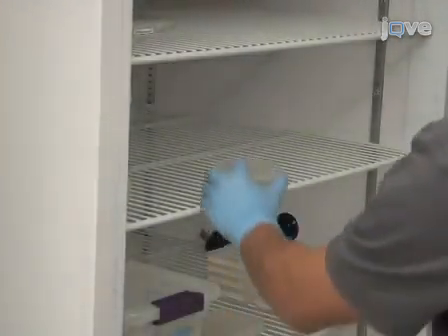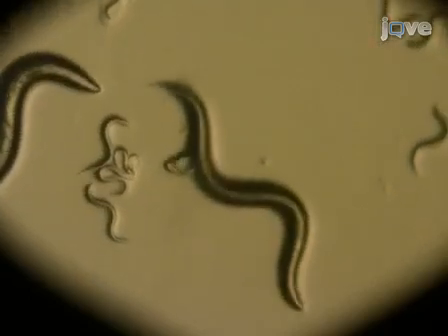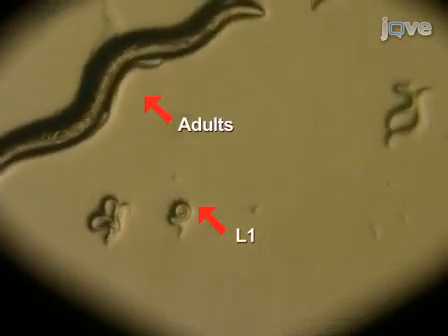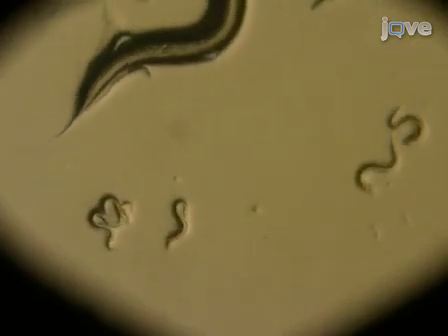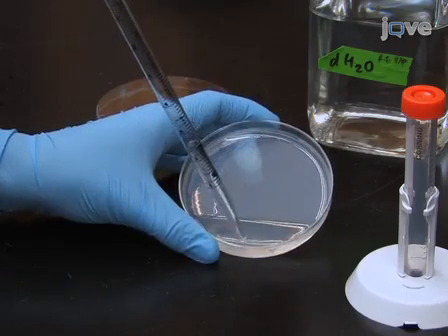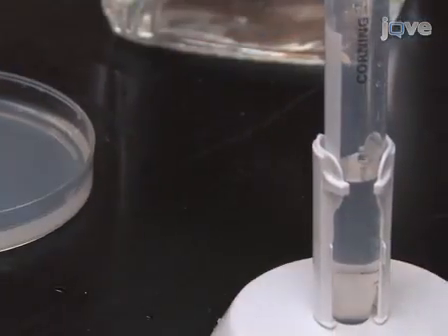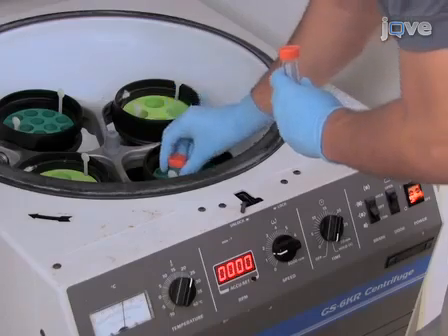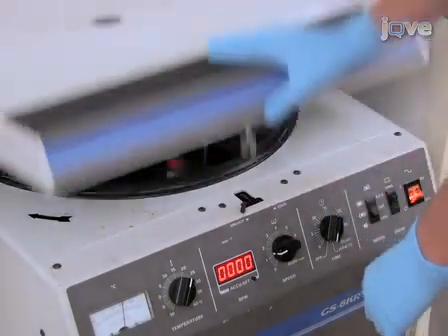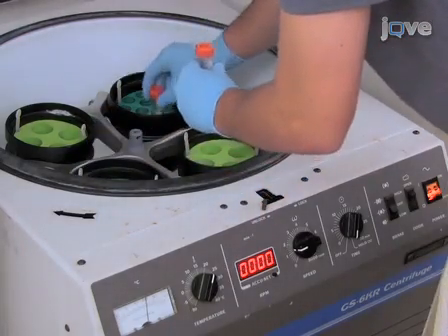Incubate the worms for approximately 65 hours at 20 degrees Celsius until the majority of the worm population consists of gravid adults. The time it takes for the starved L1 animals to grow into gravid adults may vary from strain to strain. After the incubation, collect worms from the 10 cm plate by washing them off the plate with 5 to 10 ml of sterile water. Transfer the worm water solution into a 15 ml conical tube. Wash the worms by centrifuging for 2 minutes in a tabletop centrifuge at 1,200 rpm or 280 times G.